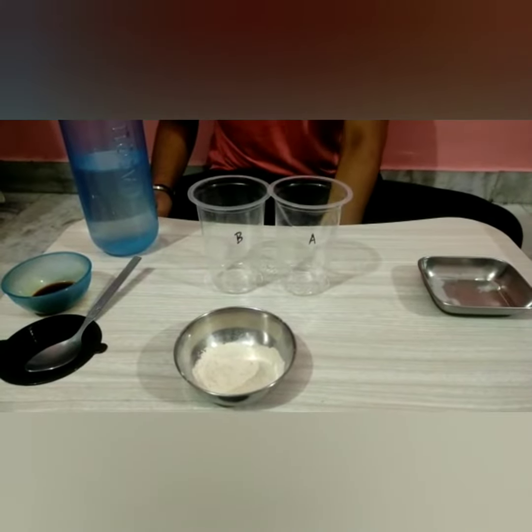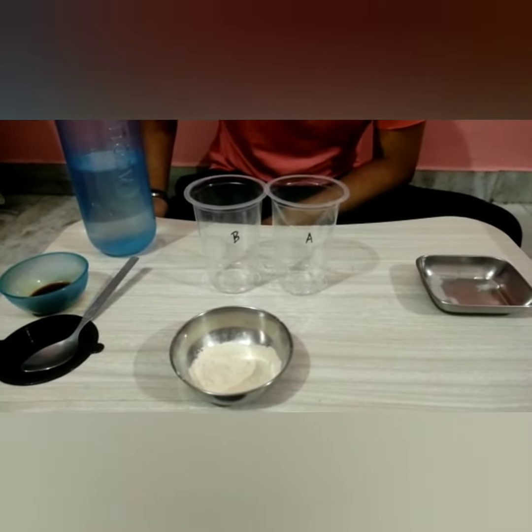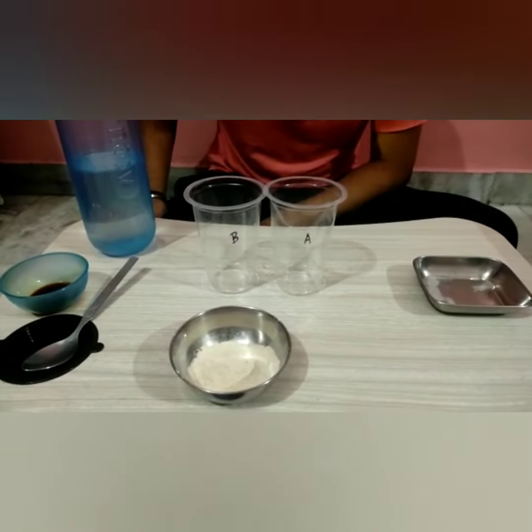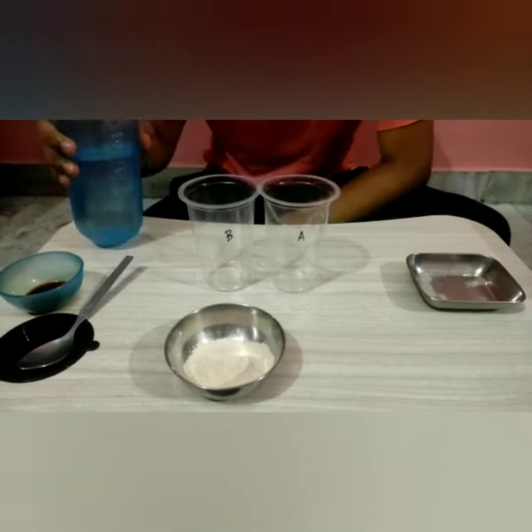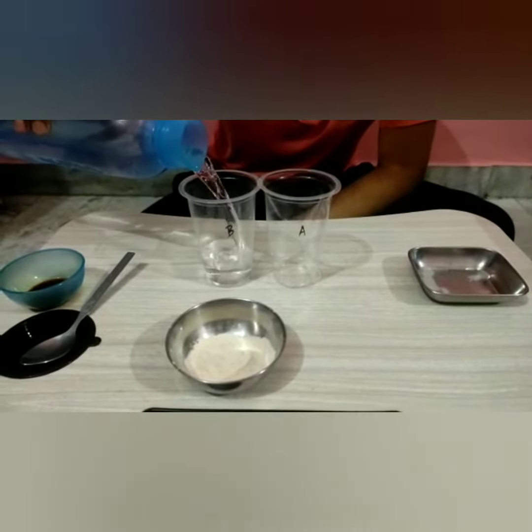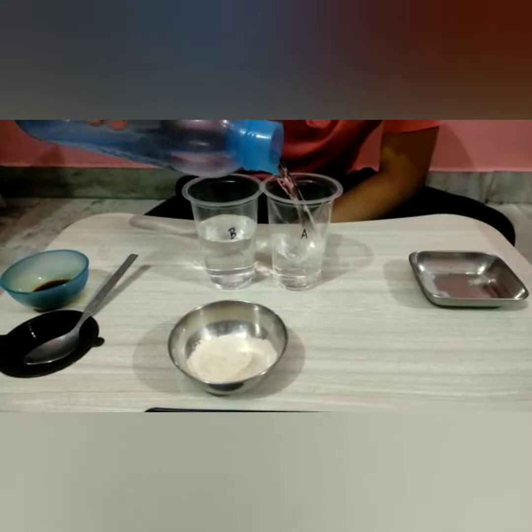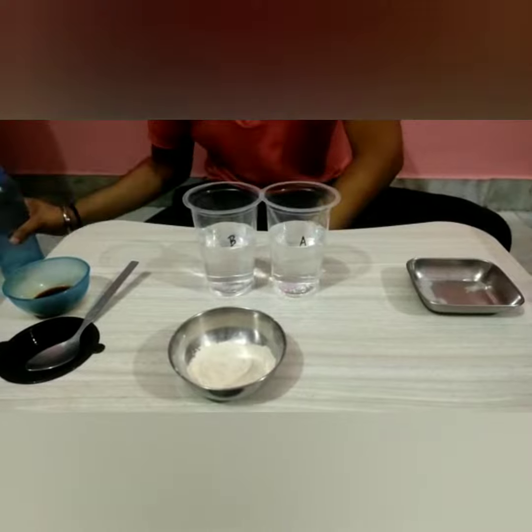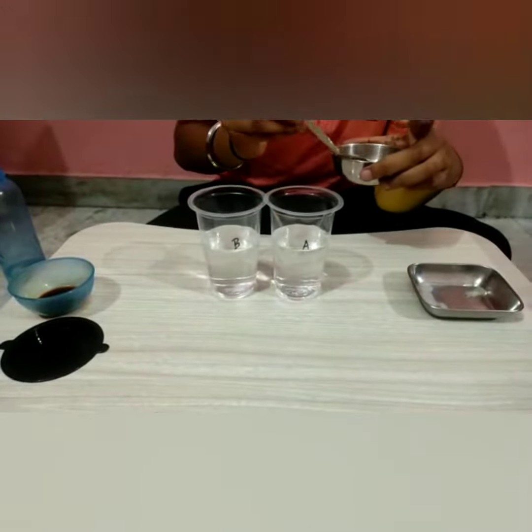Hello everyone. Today I, Radvilanga, am going to perform an activity on the action of saliva on starch. I have two glasses, A and B, and then we add water into them. After adding water, we add wheat into it, which acts like starch.